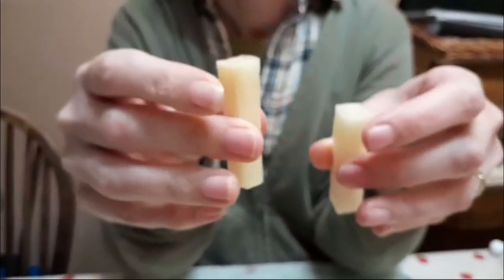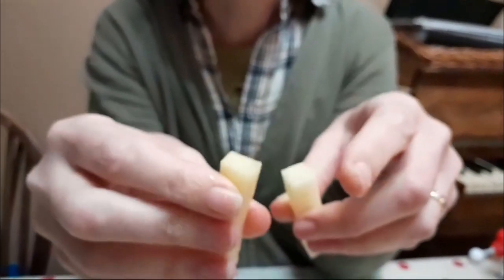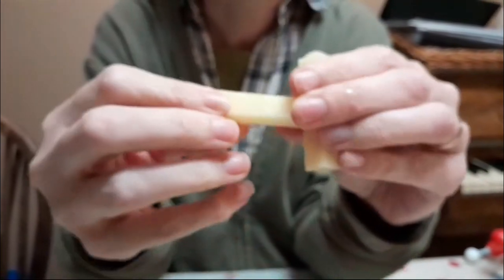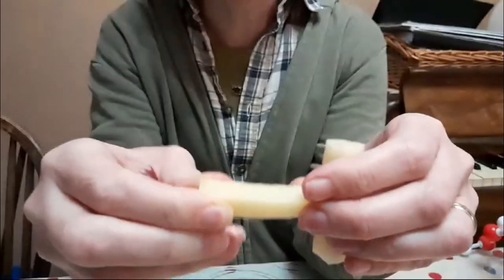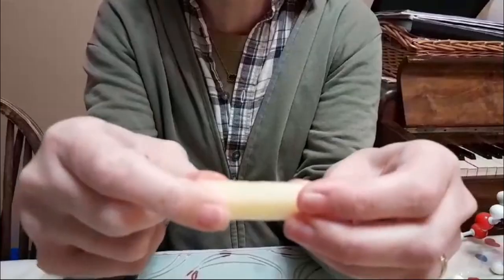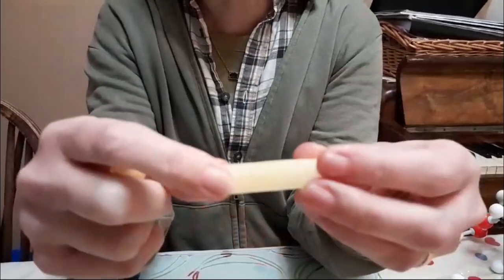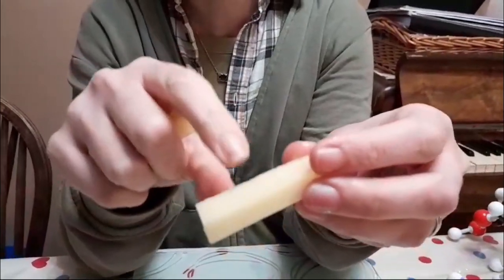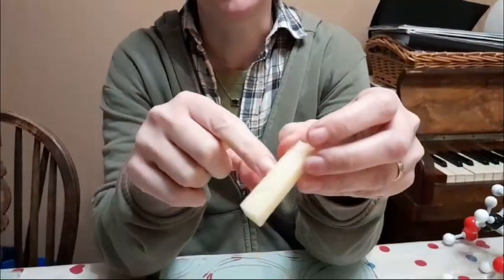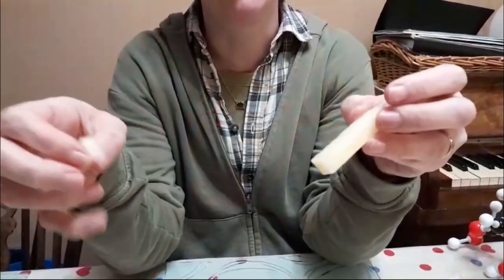This one, it's smaller, it's thinner, and it's a bit tougher because, oh no, oh look at it, it bends. It's had all the water sucked out of it. This one has had water put into it. It doesn't bend as easily and it's full. The cells are what you call turgid. They're not quite bursting at the seams. The cell wall is stopping that. If this happened to our cells, our red blood cells, they'd burst open.